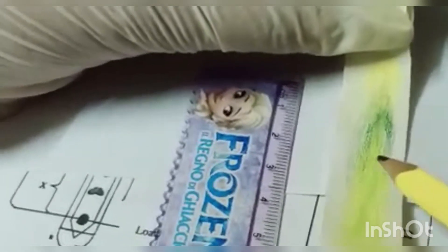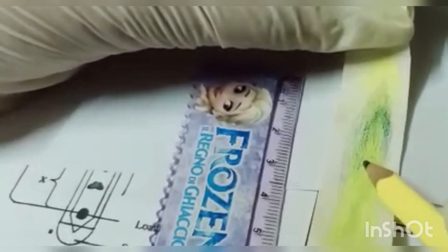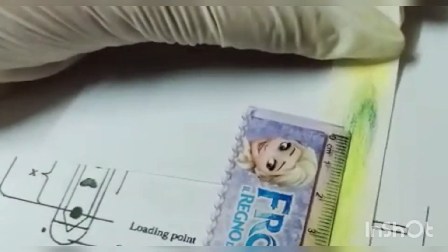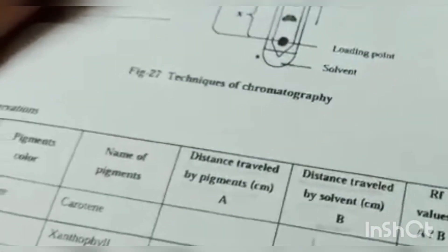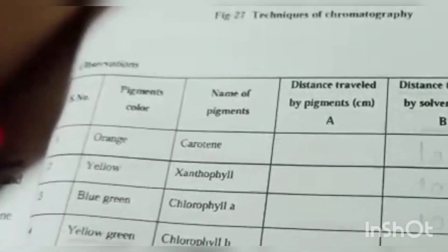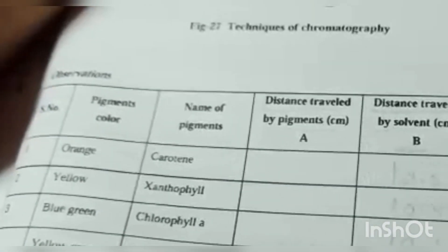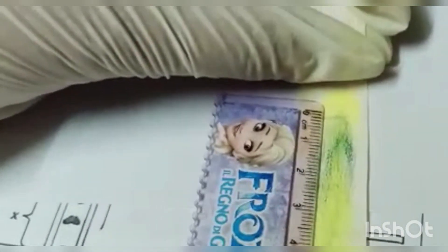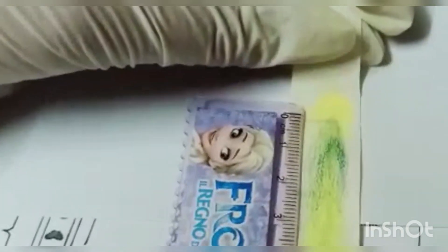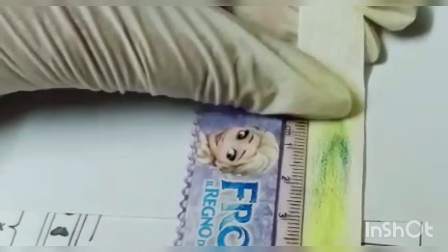We will now identify where the light yellow, light green, or yellowish-green color ends and mark that point. Measuring from the loading point, it is about 4.5 centimeters — this yellowish-green color indicates chlorophyll b. Next, we measure the dark green color from the point of loading — there is a light green and a dark green band — and the dark green color is about 6.3 centimeters.